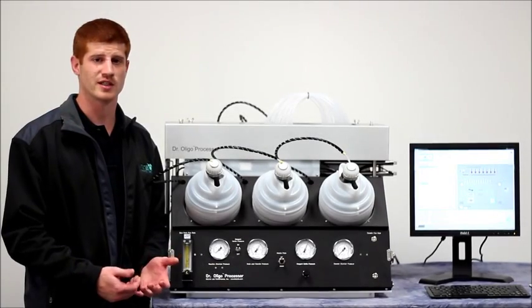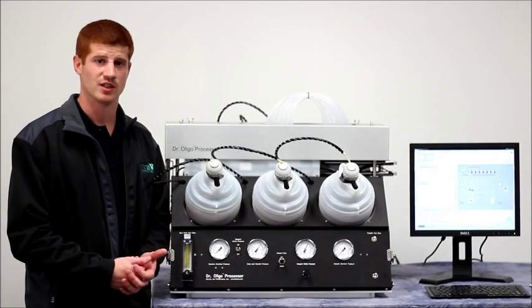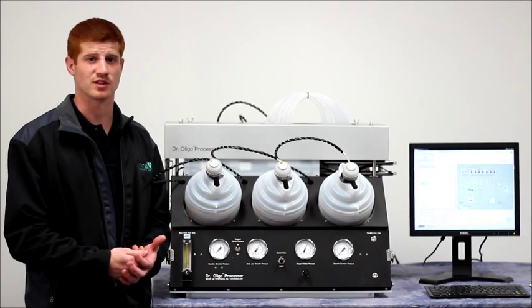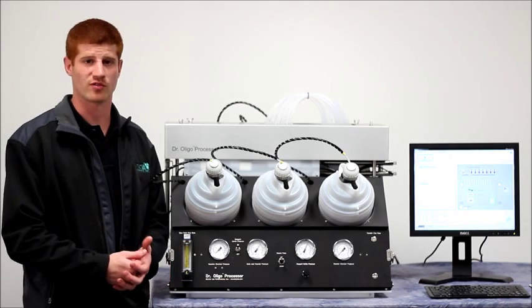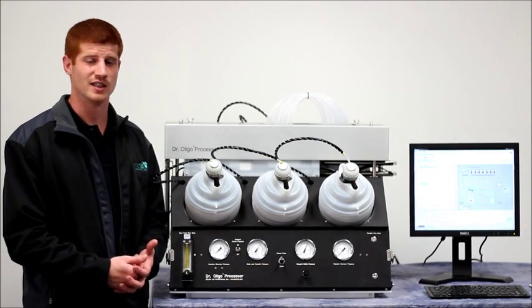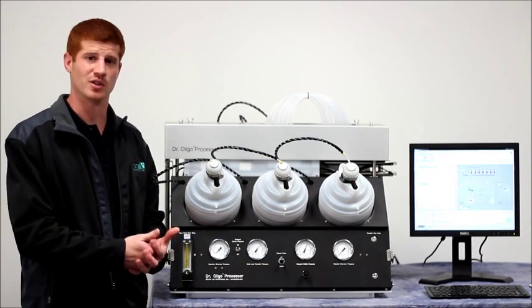Normally, after all your reagents have been delivered to the reaction plate, the purified product will be bound to the cartridge whichever you're using. The next step in this process is to elute your purified product from the cartridge into the collect plate that we put in at the beginning of the procedure.